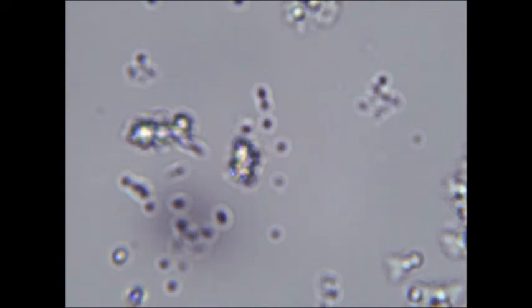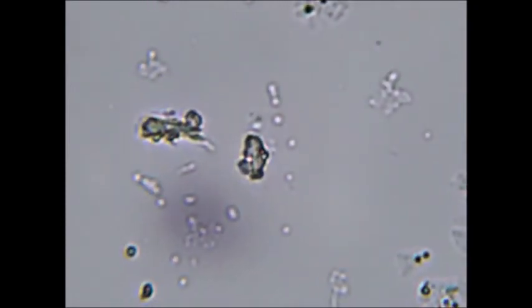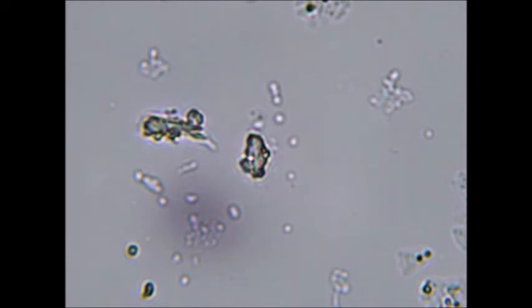Again, this is stained with 20 drops of Sudan 3. As we can clearly see here, there are more of the round structures, which I believe to be fatty acid vesicles. And so I can conclude that my experiment here was most likely a success, even though I will be trying the same experiment next using a different method in order to get more clear-cut results.